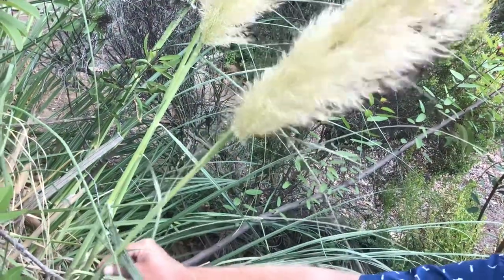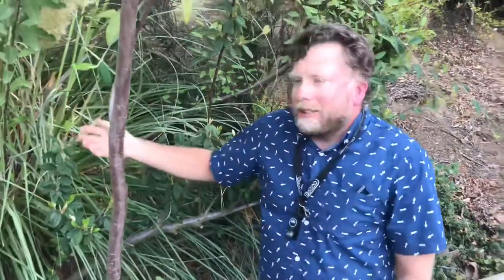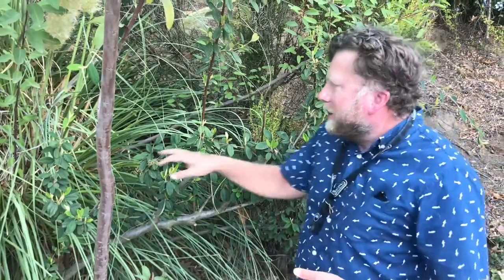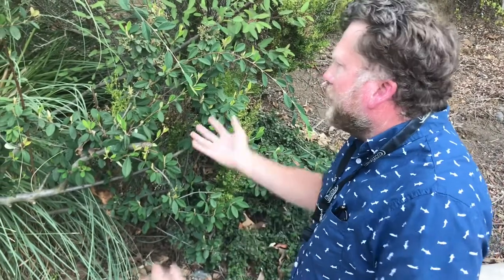I'm going to take a bit of this plant — probably this bit right here — and press it in our press. The other very important thing besides the collection itself is all the information about where you got it: what date it was, where it is, location, GPS coordinates. You also want a description of both the physical and biological situation — what community it's in, what other species are around there, whether it's just a single individual or a huge population. A lot of that information — the natural history of the area — will go into the label that gets affixed to the plant and deposited in the herbarium.